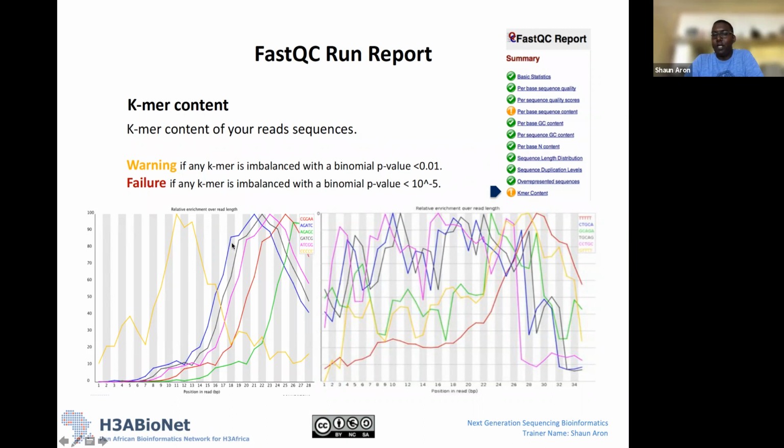And what you expect is, for example, if positions 1, 2, 3, 4, 5 had some primers still stuck to them in your reads, you'll see something like this happening at the beginning, where you have a very high representation of particular k-mers at a particular region. And that's usually the case if you have, for example, primers still attached to your data. Essentially what you want to see is not to have any overrepresentation of a particular k-mer in a particular region of your read, again, unless you're expecting to see this based on the experiment that you are running. So again, you just need to interpret this based on what you're expecting to see.